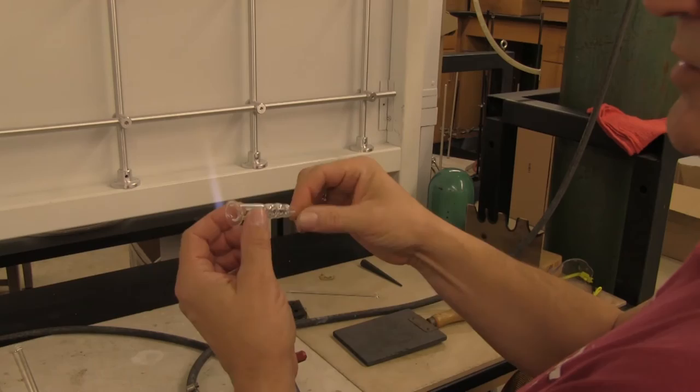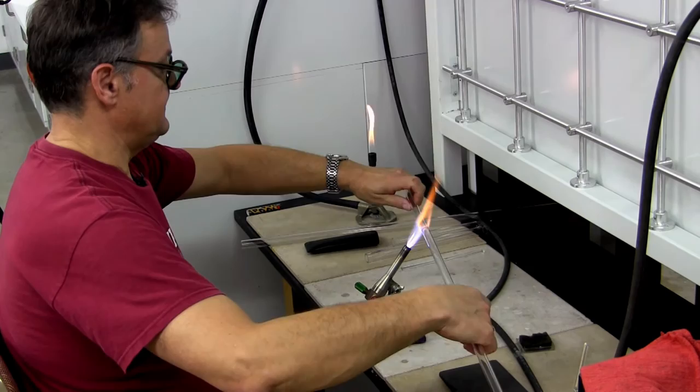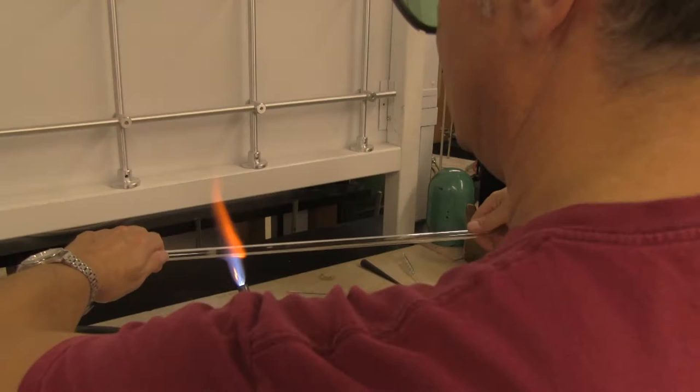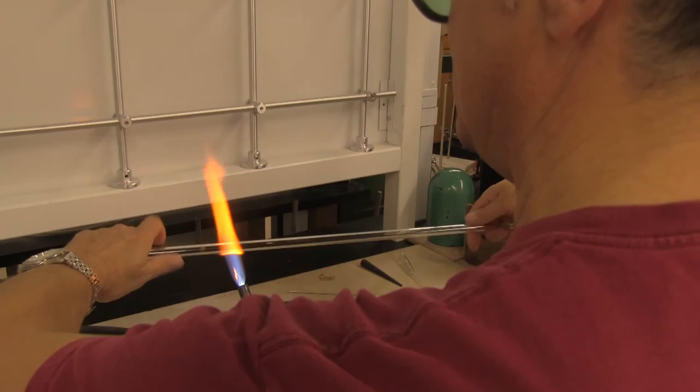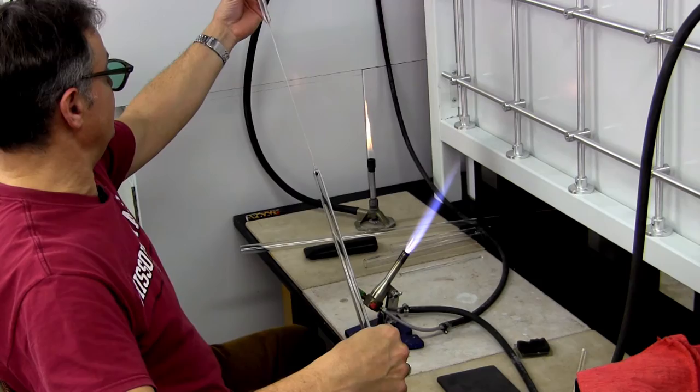Like this little piece, this is broken, to repair a broken piece of glassware. In order to do that, we have to have glass stretched to have a needle. A needle is important, that thin part coming out of the pipe because it will become a handle.